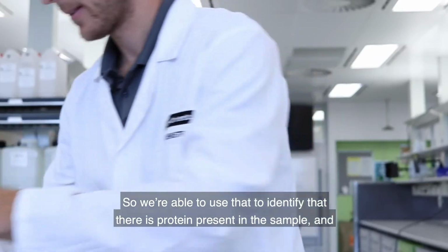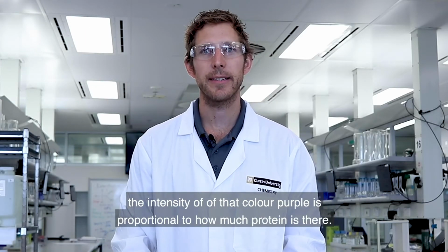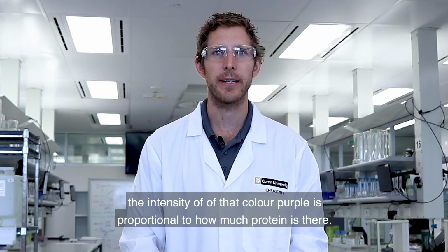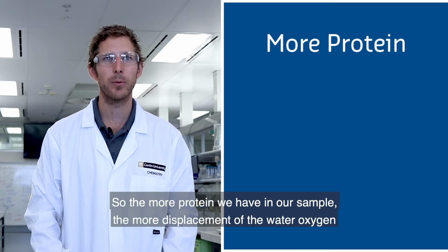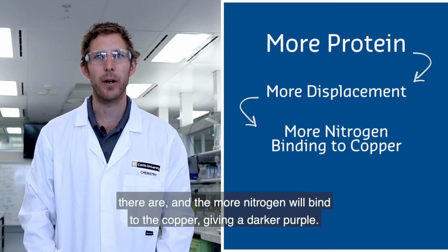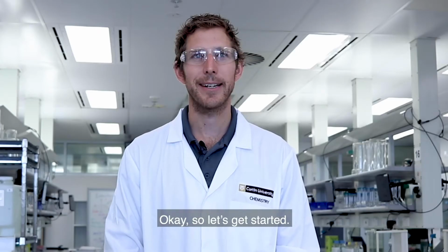So we're able to use that to identify that there is protein present in the sample, and the intensity of the color of that purple is proportional to how much protein is there. So the more protein we have in our sample, the more displacement of the water oxygens there are, and the more nitrogen will bind to the copper, giving a darker purple. Okay, so let's get started.